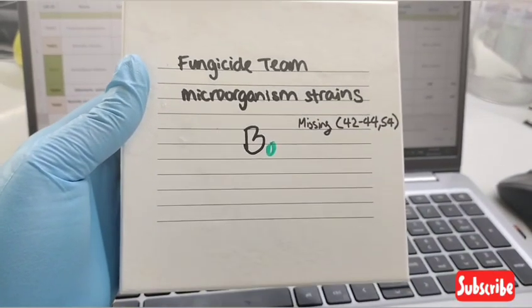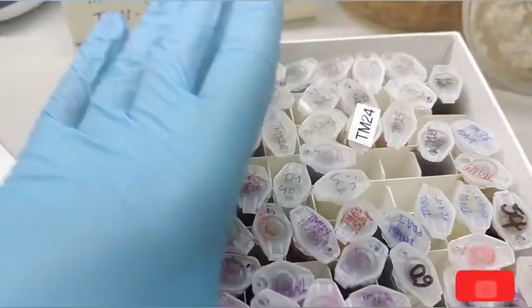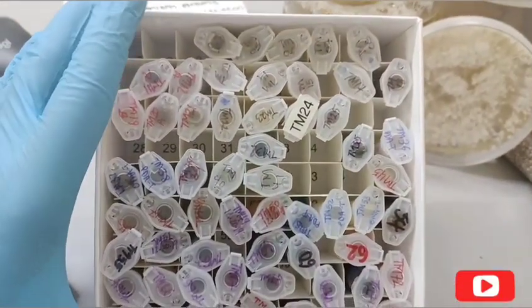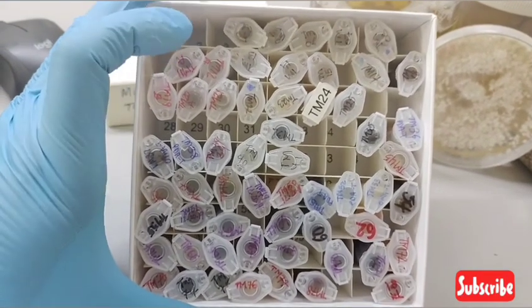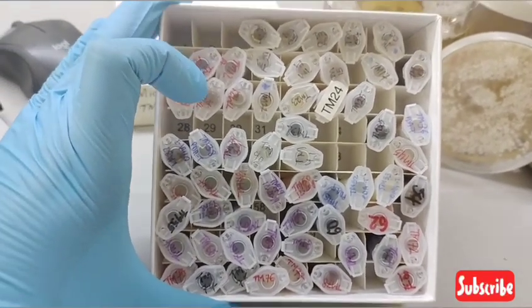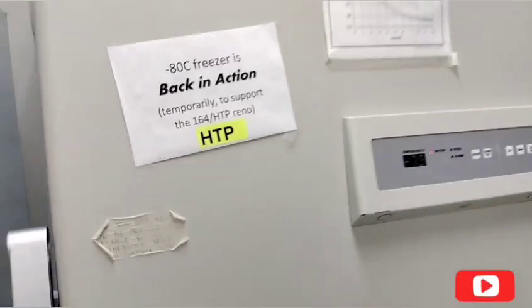I'm looking for some pathogen that I need to subculture. It's missing, so I'm going to go check the -80 to see if it's in that freezer. Pray for me, it's really cold. This bad boy. It's not that -80, but whatever.